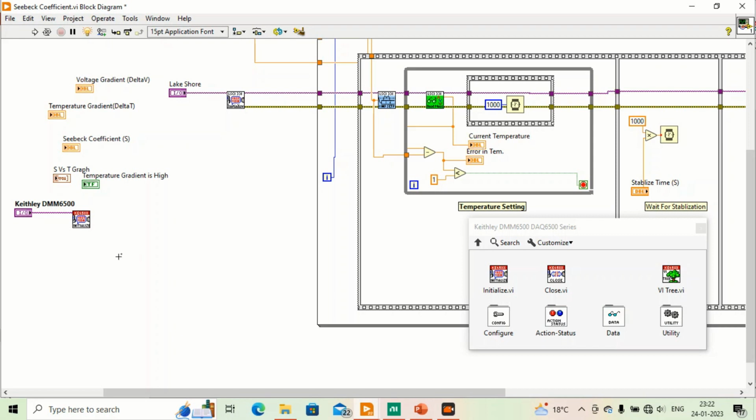Okay, as you know that in Seebeck coefficients you have to make two main measurements. The first one is voltage difference and the second one is temperature difference. So you should have two different instruments to measure these things, or you should have a 10 channel scanner card kind of thing so that you do not have to change these things during measurement. Okay, so I will use that one.